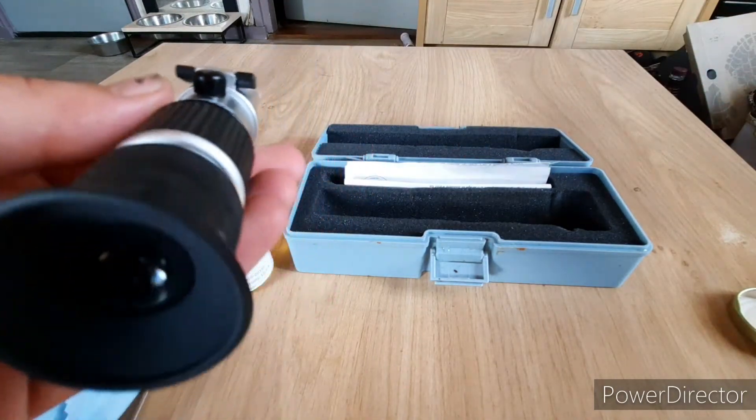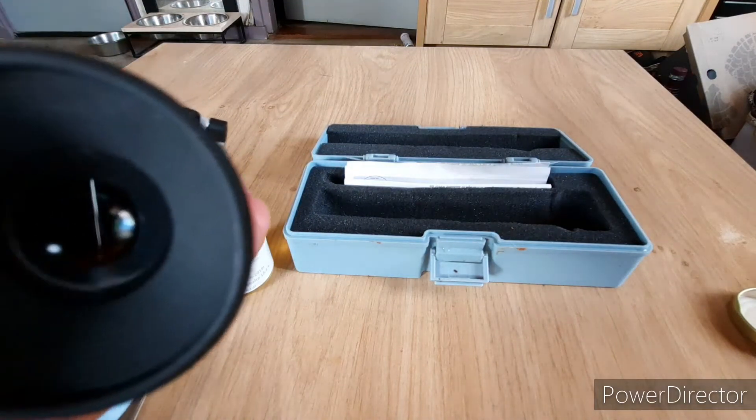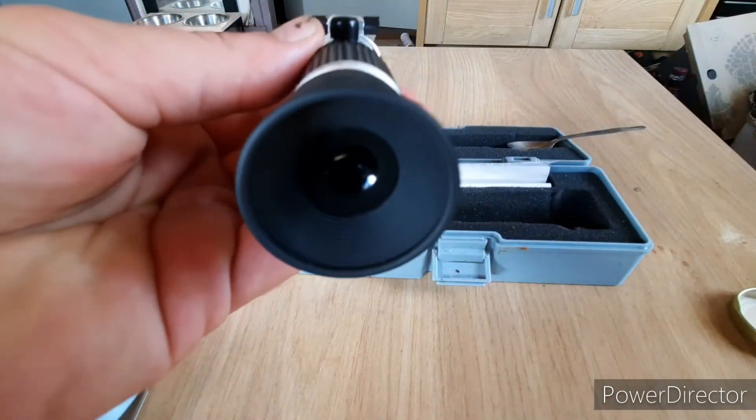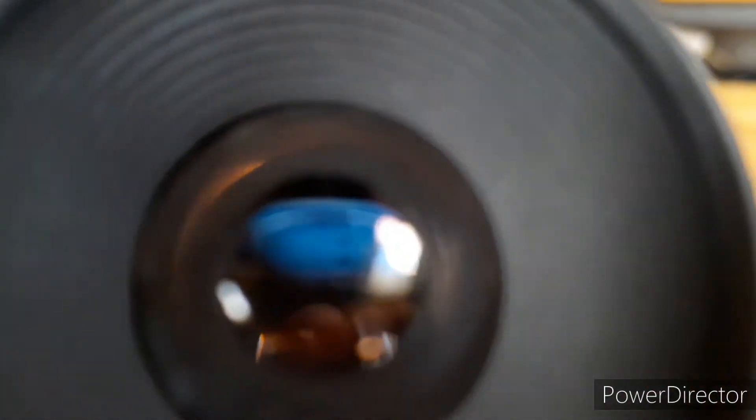And then we look into the lights and we can see, but I have to take another shot for that. Well here you can see through the lens. The light breaks and it will show you if it will focus. There it is. It's not very visible but on the right table it says 19.2 percent water, so it's a bit off.